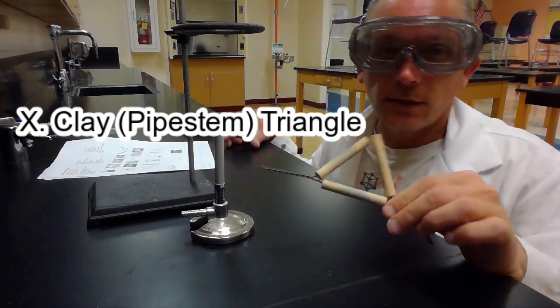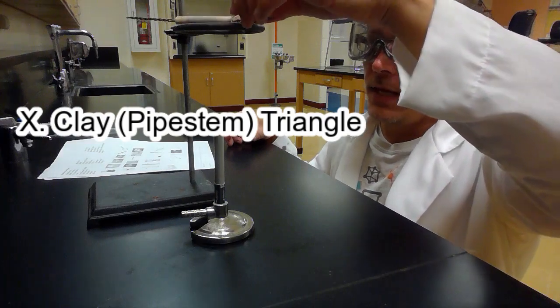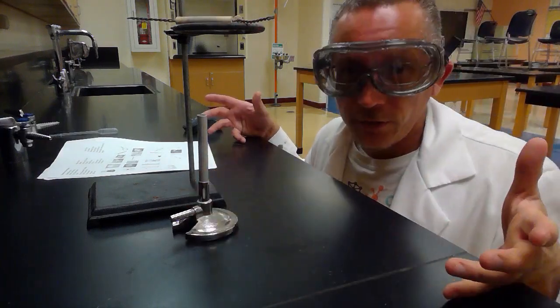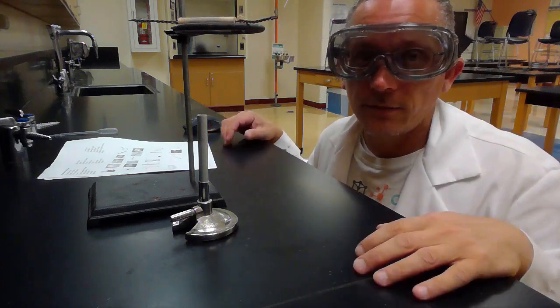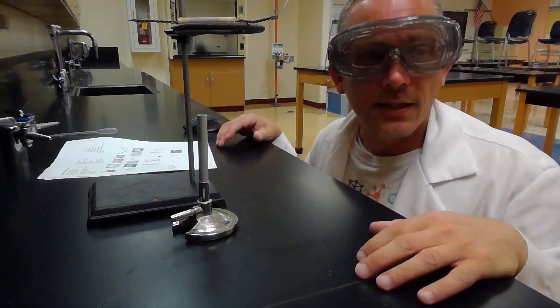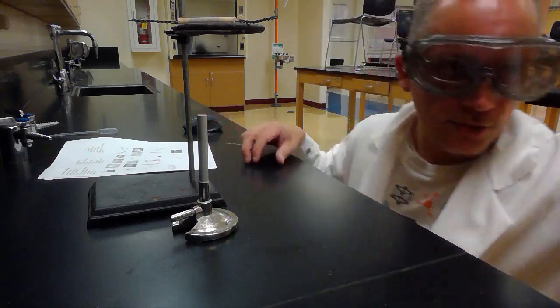Picture X, this is what's called a clay triangle. We could put that up here, and we can heat that, and the clay triangle will not burn, right? So it's a good place to put something to support something. The clay triangle sits up there and supports something. What kind of thing can it support? It can support picture H.